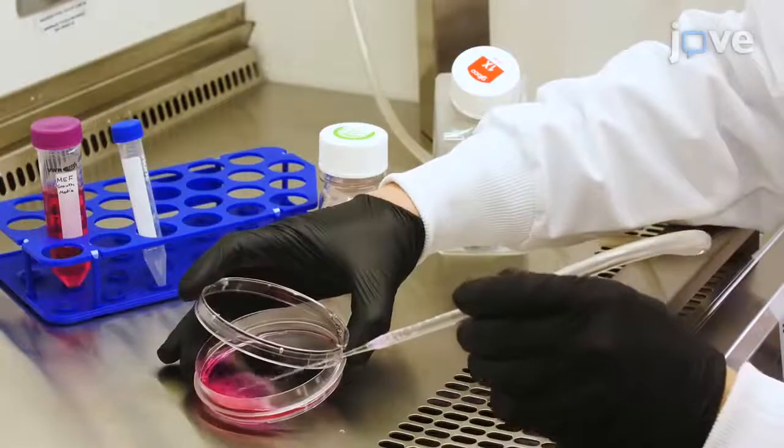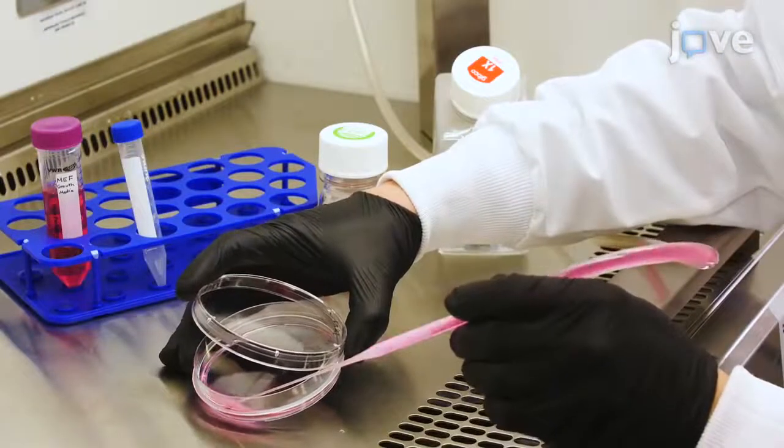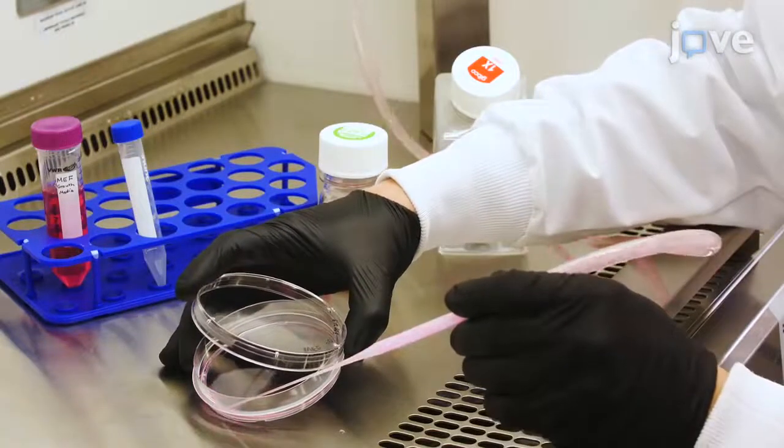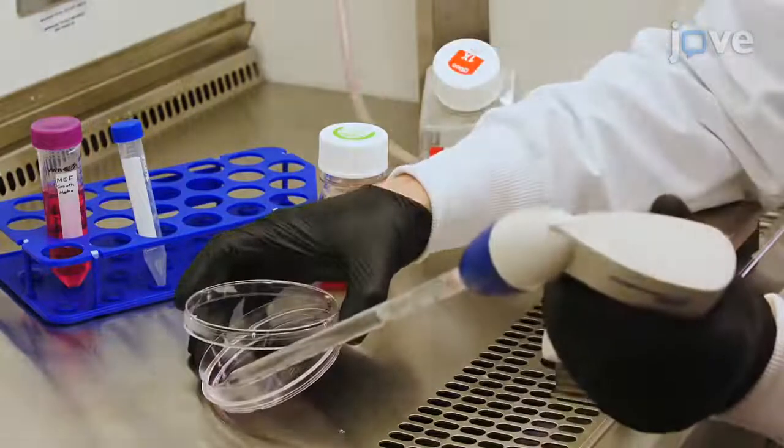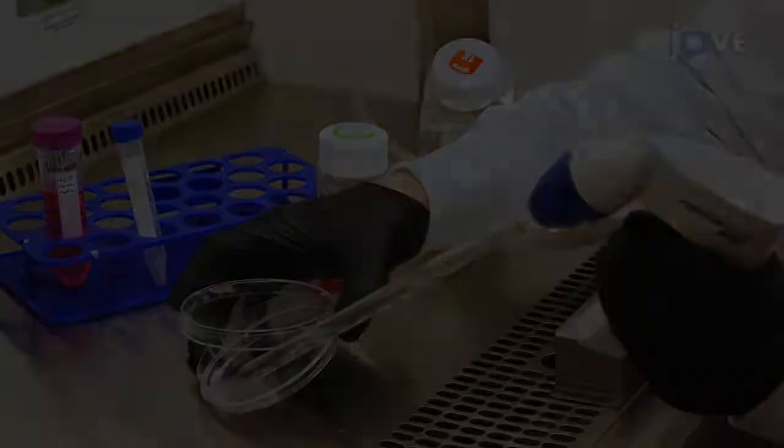To trypsinize cells, first carefully remove the growth medium and wash the cells with 10 milliliters of 1x PBS.